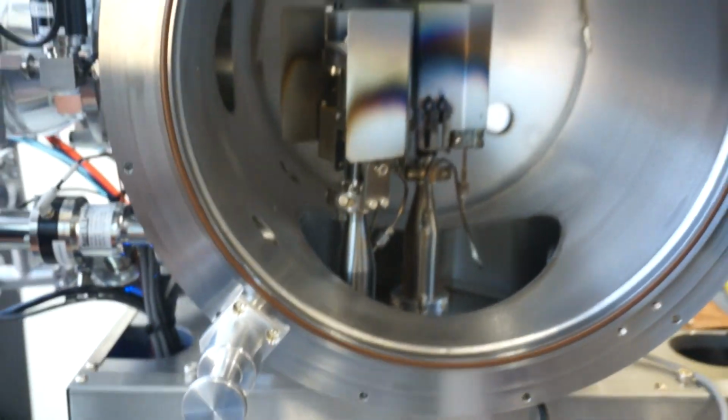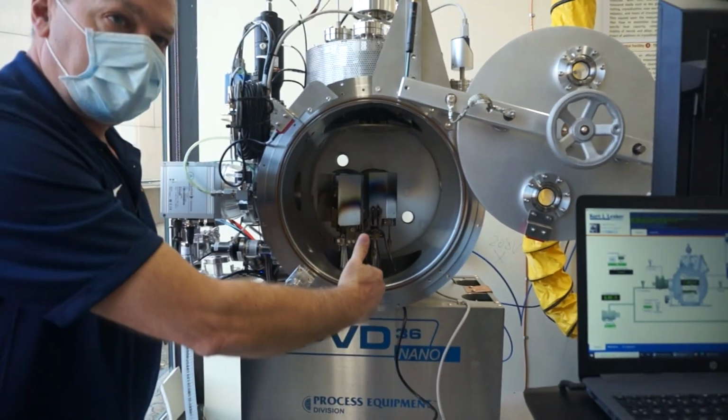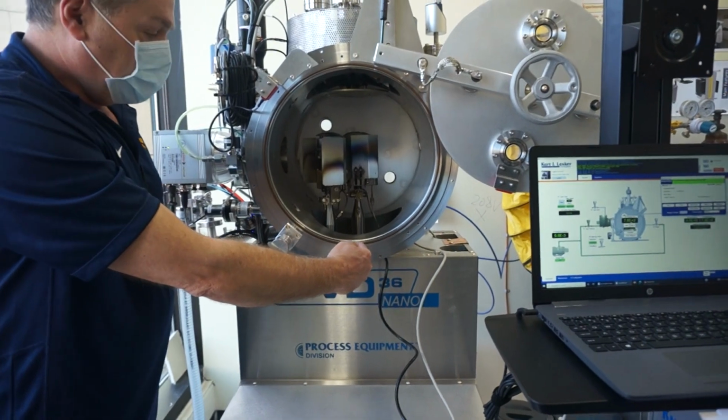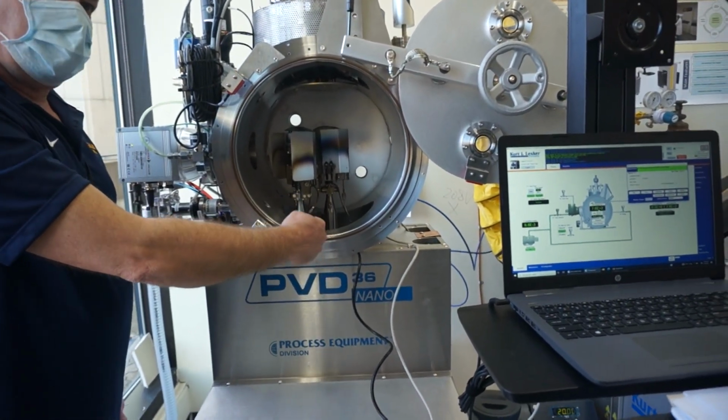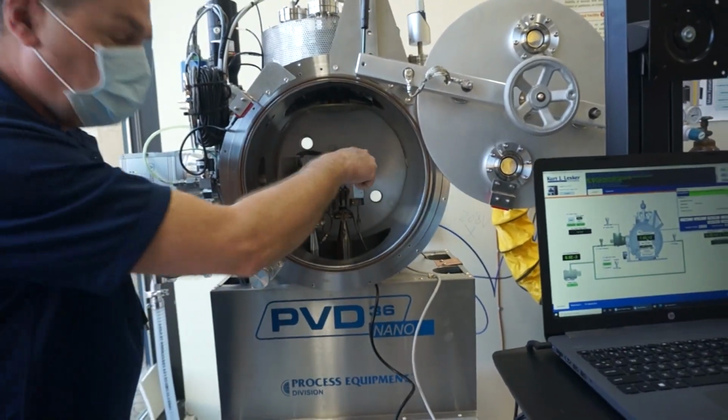In the Lesker scheme of things, depending on the configurations you have, if this was, let's say 6 o'clock, right in the front, if there was a gun right here, that's number 1. If there's nothing there, and there's a gun exactly to the left, that's number 1. Okay. So 1, 2, 3.